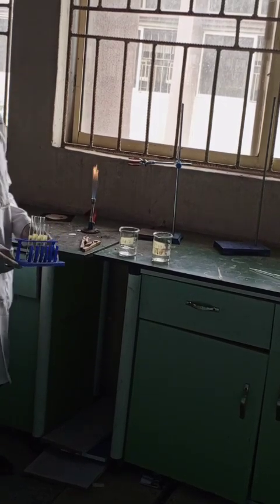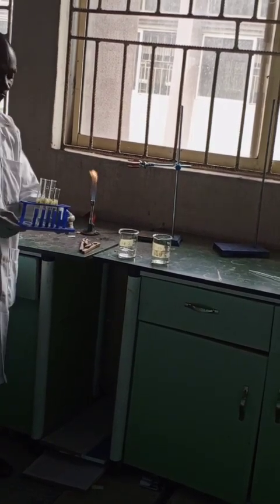Now, effect of temperature. We have four test tubes.